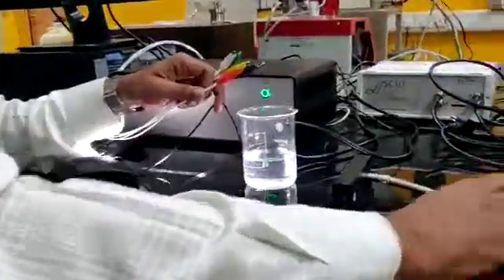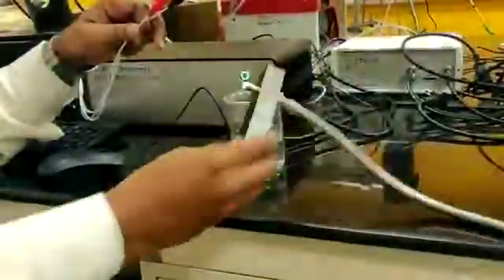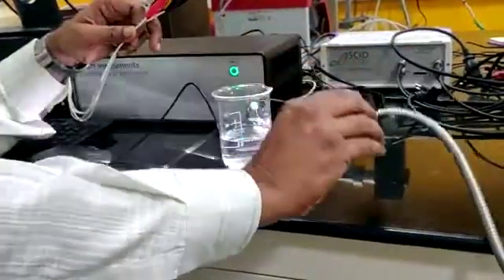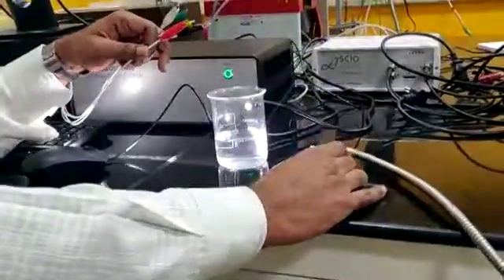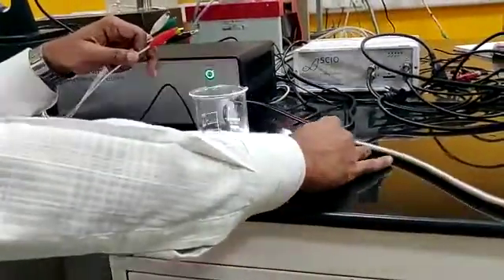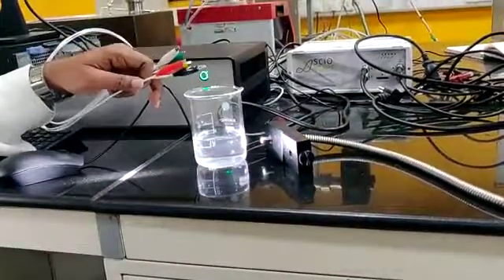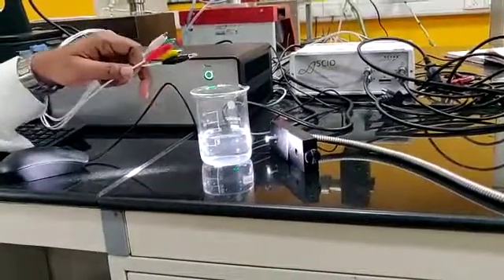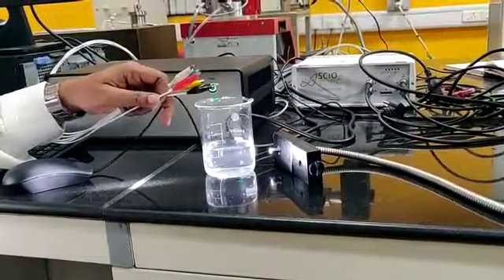This is what we call white light — it will probably be too intense. This light is shined on the sample. Now, we are allowing that white light to shine on the sample, and we can do the photo-electrochemistry.